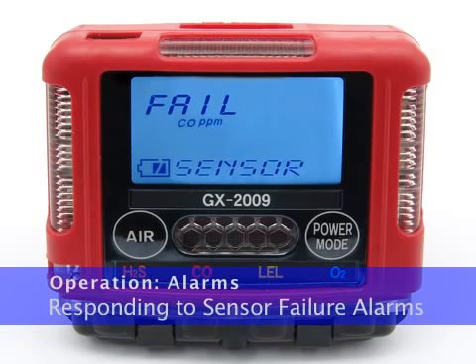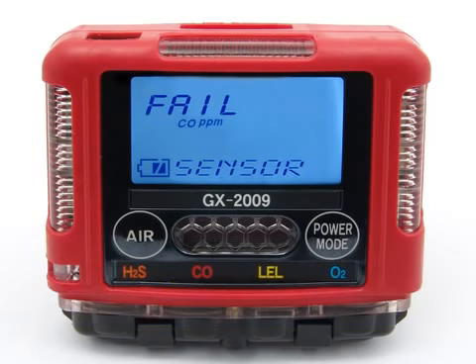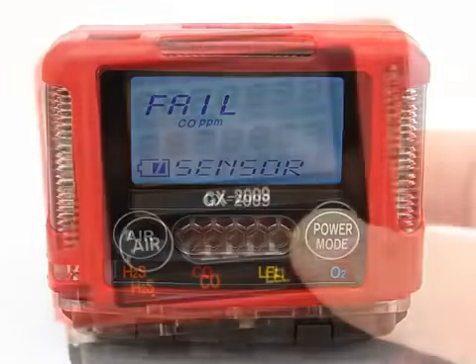Determine which sensor has triggered the sensor failure alarm. Try calibrating the sensor before replacing it. If the sensor failure continues, replace the sensor. If the sensor failure condition continues after you replace the sensor, contact RKI Instruments for further instructions.